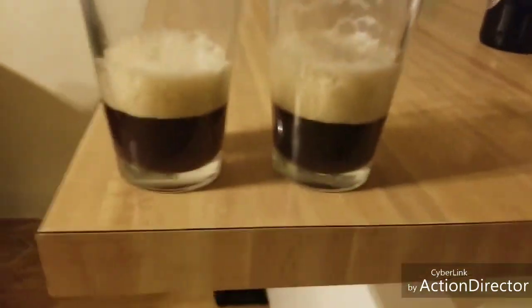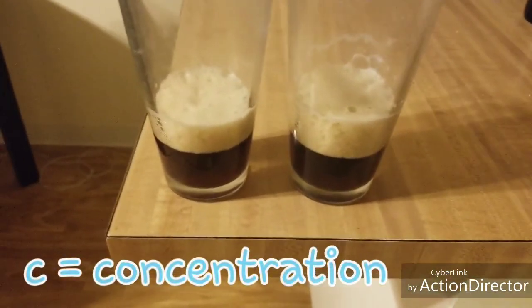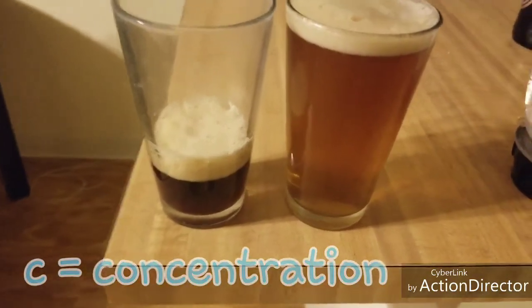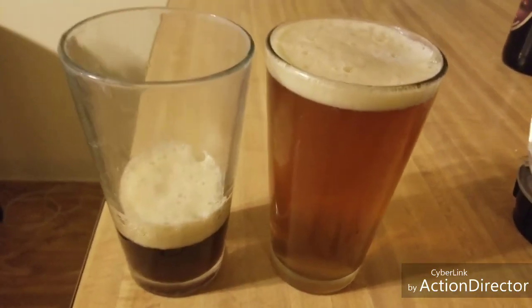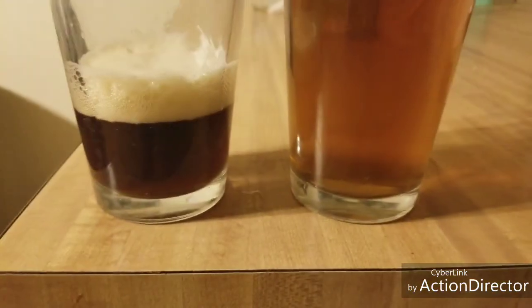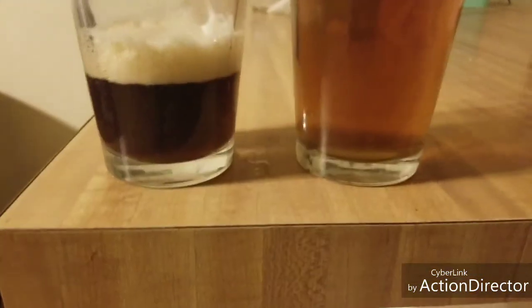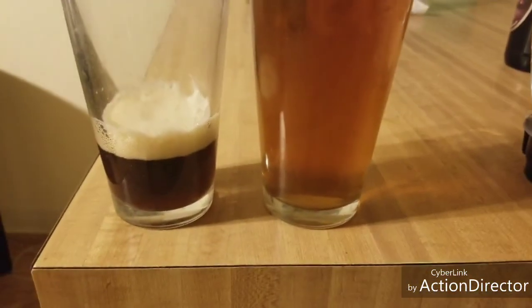Concentration. You can see that if I have two glasses of beer that are exactly the same color, and then I actually dilute one with water, one's going to get a lot lighter. That's because we are lowering the amount of light absorbing molecules per volume of sample. We're still looking through the same path length here, but one is diluted to about a third of the concentration, maybe a quarter, and it will appear a lot lighter because there's a lot less molecules that are absorbing the light that is passing through.